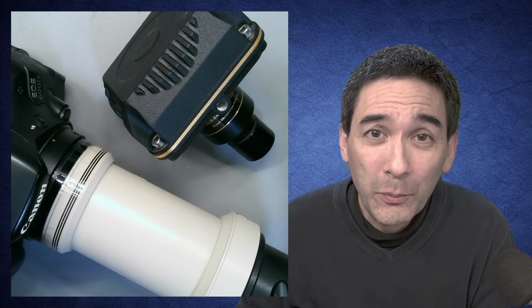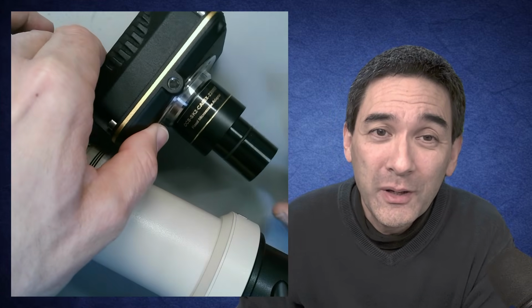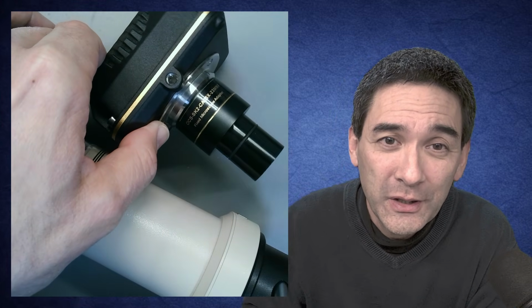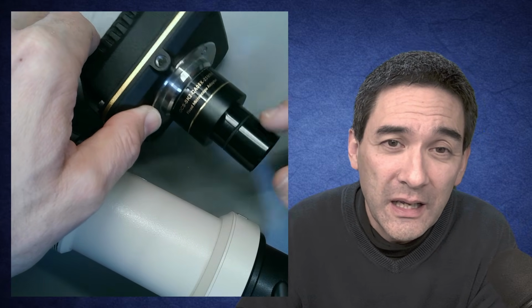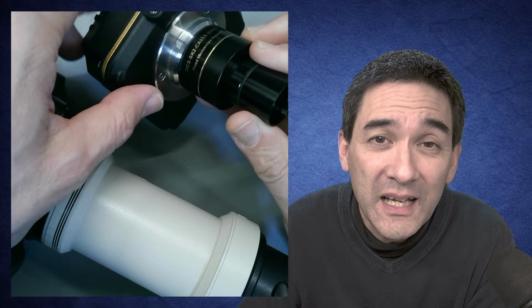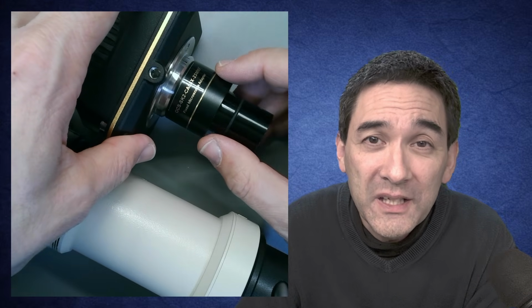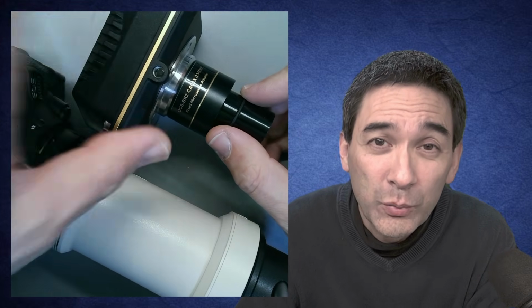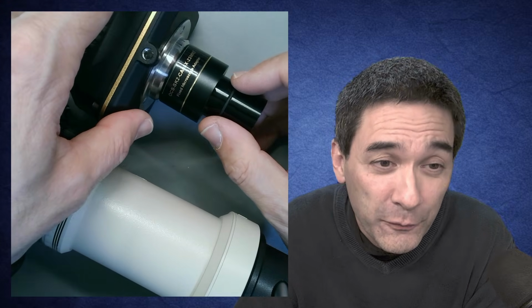Today I want to talk about the intermediate optics of microscope cameras. I need to explain this: what even are the intermediate optics? When you have a microscope camera like this one, this part over here is called the intermediate optics, and there are some lens elements here which adjust the size of the image for the camera. Those intermediate optics have a different magnification, and I would like to talk about this magnification because it can be quite different.